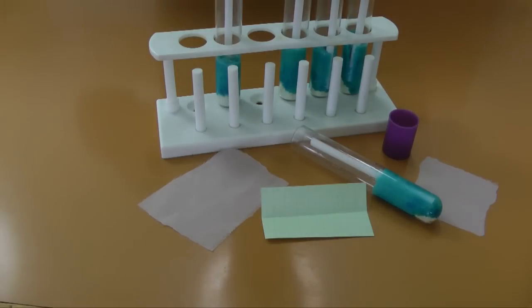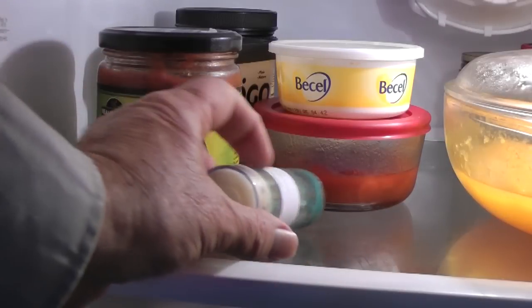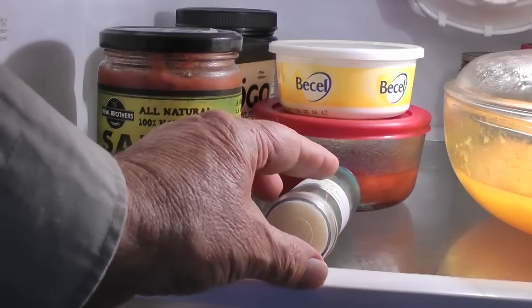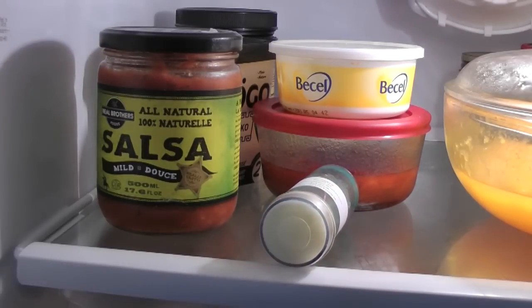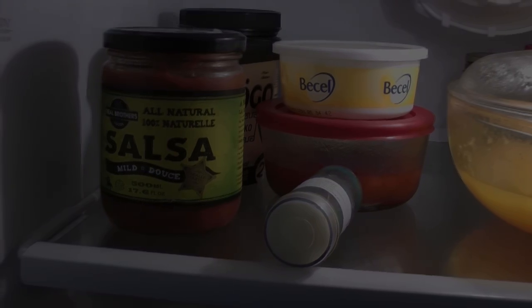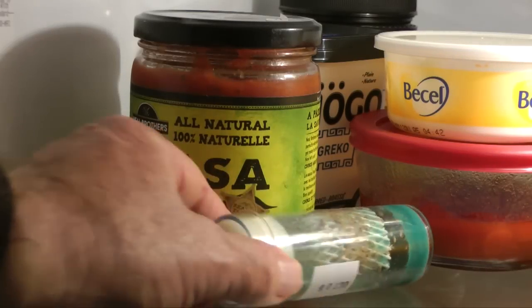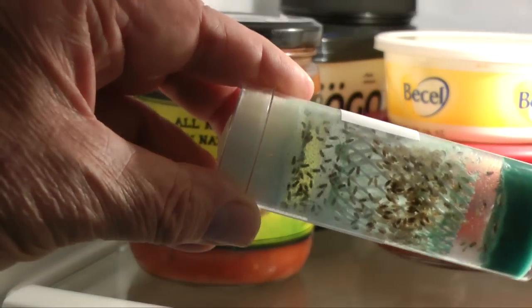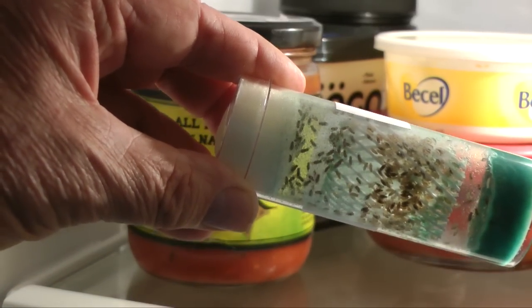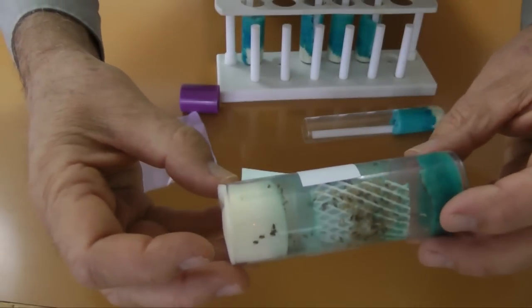Once the tubes are prepared, transfer some flies. I do this by placing the parent colony in the refrigerator or on some ice. This temporarily immobilizes the flies. Check the flies every five minutes. Once all activity has stopped, remove the flies from the fridge. Don't leave them chilling for any longer than necessary.